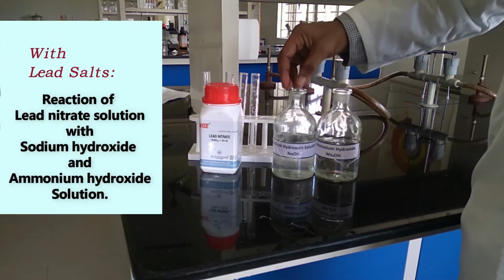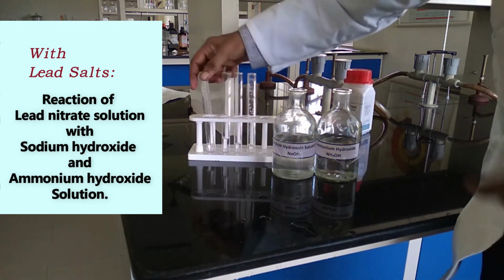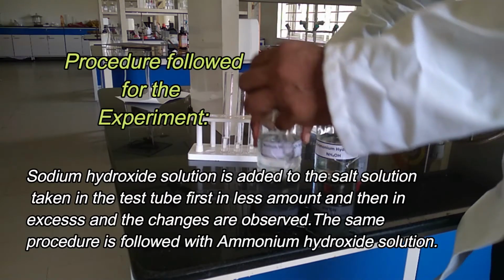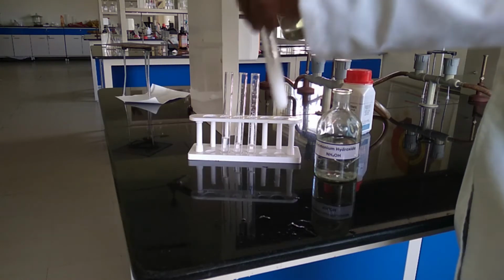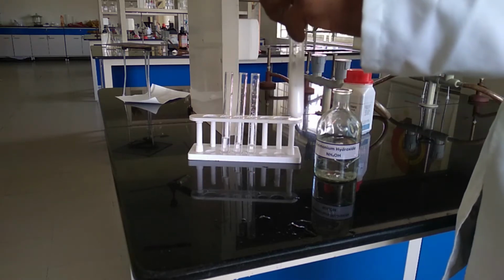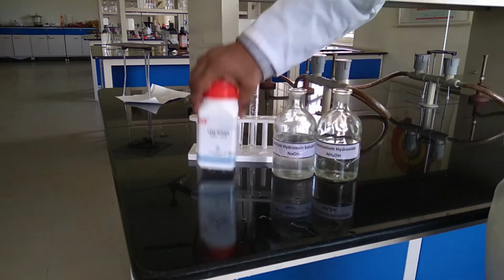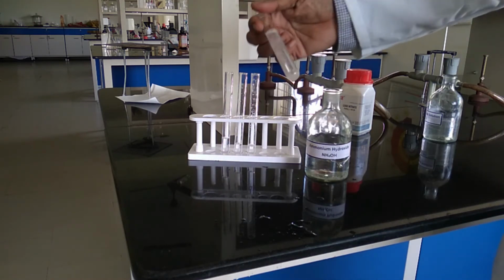We are going to see the effect of sodium hydroxide and ammonium hydroxide on lead nitrate solution. First, we add sodium hydroxide in a small amount to the lead ions. It forms a white color precipitate of lead hydroxide. We add in excess. The precipitate is getting dissolved into it. See, the precipitate got dissolved into it.